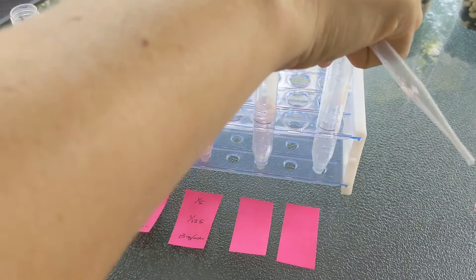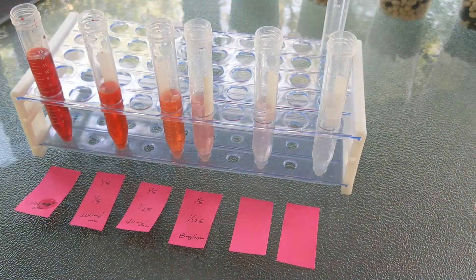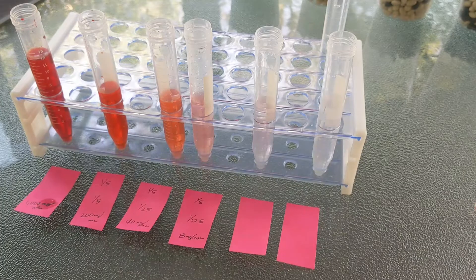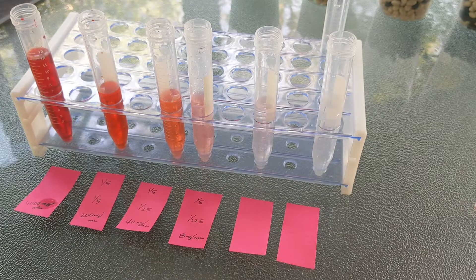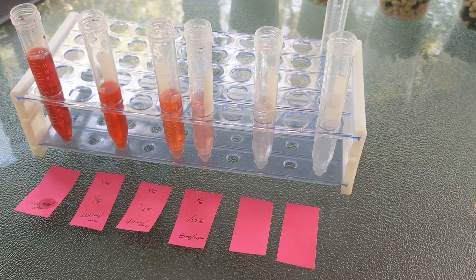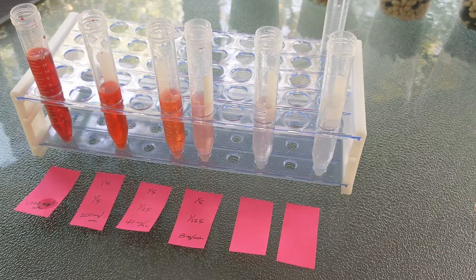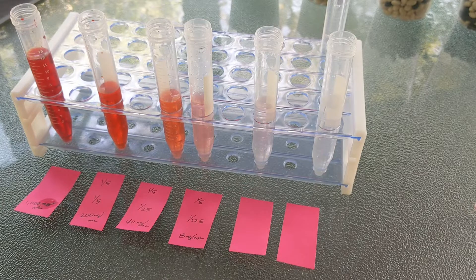By the final tube, you can barely see any dye because it's so diluted. Hopefully you have your fraction written down of how diluted it is — it should be in the thousands. Pause if you need a little more time; I'm going to set up the next one.